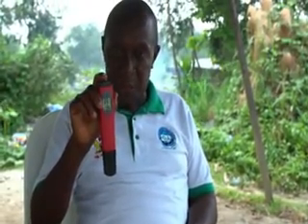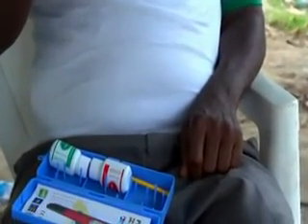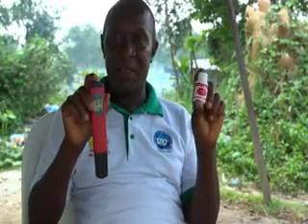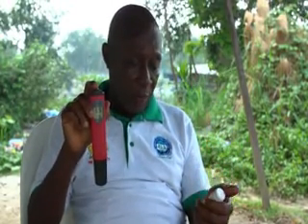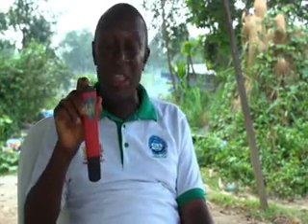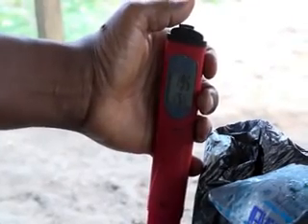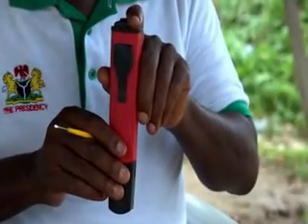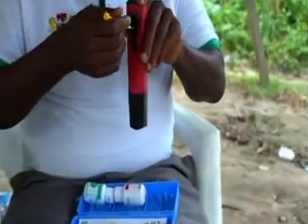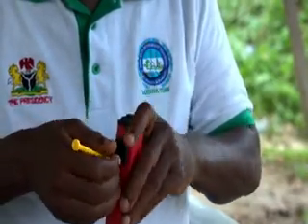We have to calibrate the pH meter using two different reagents. One is for the acidity of the water. This reagent — this reddish one — is for acidity; it is for pH 4.003. You need to calibrate when you have this reagent down to a temperature of 25 degrees Celsius. There is a particular portion where you use a screwdriver to calibrate it. Once the temperature is 25 degrees Celsius, you calibrate it to 4.003.